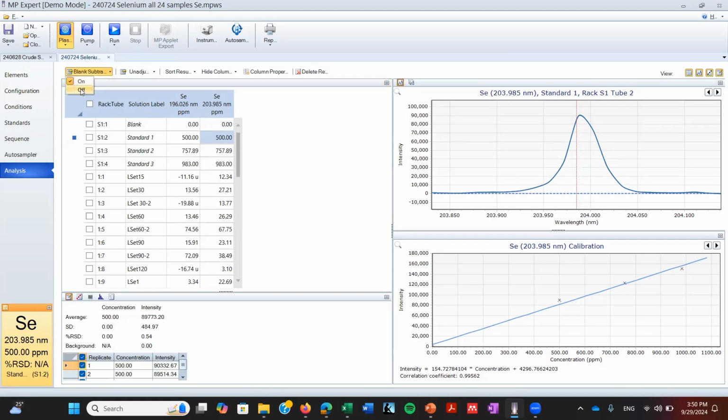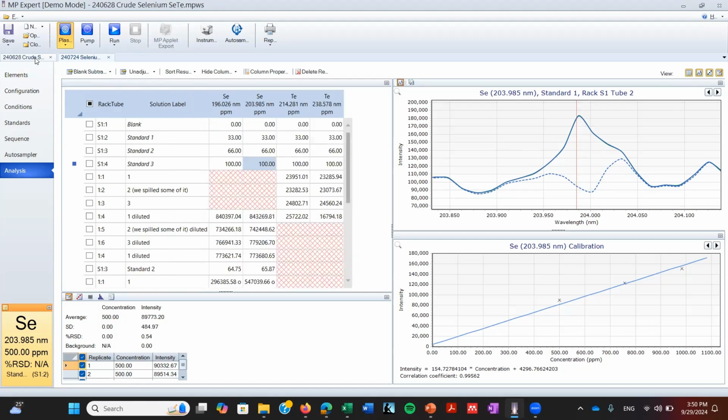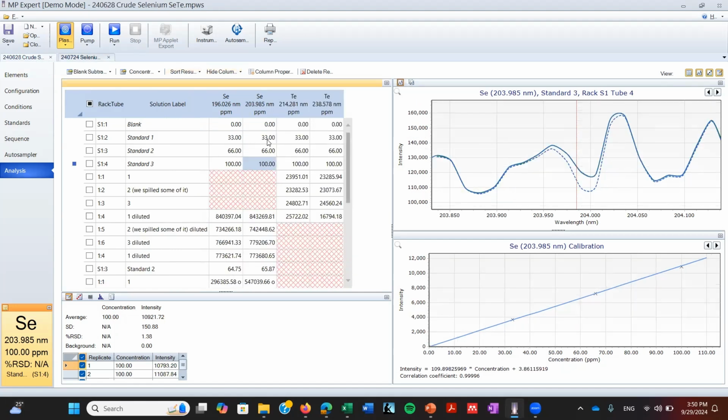However, if we turn off the blank subtraction, we're going to see that the blank is not completely flat. The blank is the line that you can see here. Now, something interesting is that we already corrected this, because when we started doing this, we were going with 33 ppm standard, 66 ppm standard, and 100 ppm standard. And as you can see, there's no peak. So at the end, what my equipment is measuring is the difference between the blank and the signal, but there's no clear peak.